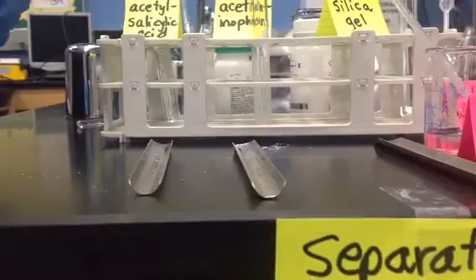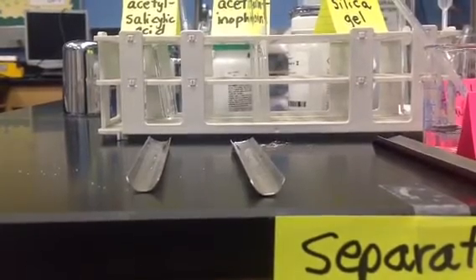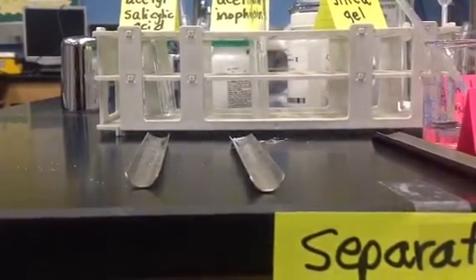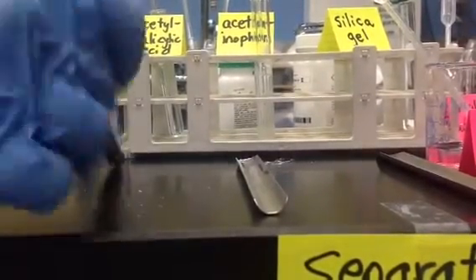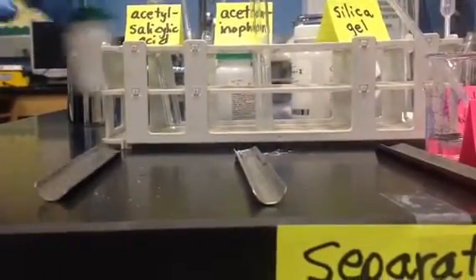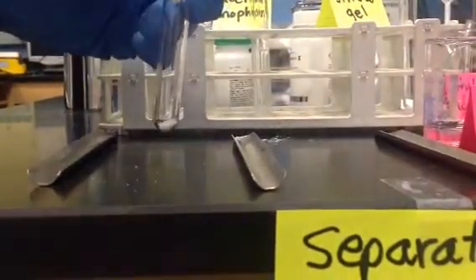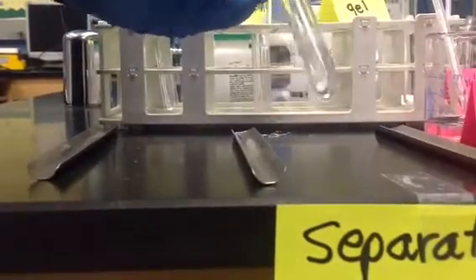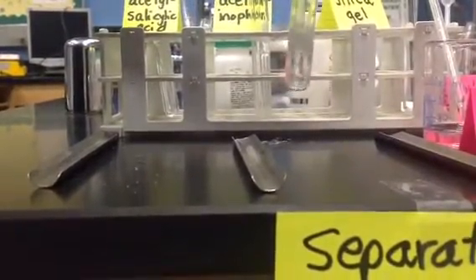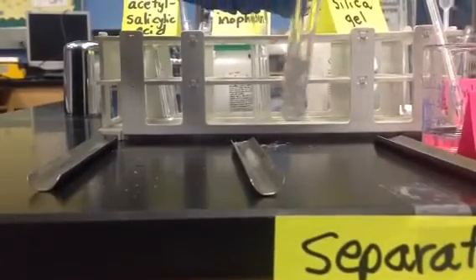dissolving the acid. So just to verify that, I've got a fresh stirring rod. I'm going to get a fresh test tube, another pea-sized amount of the acetylsalicylic acid. There's my amount. I'm going to add my sodium bicarbonate. And this is what it looked like when you were trying to do this. So again, we're going to really have to use a stirring rod. See if we can't make this dissolve.